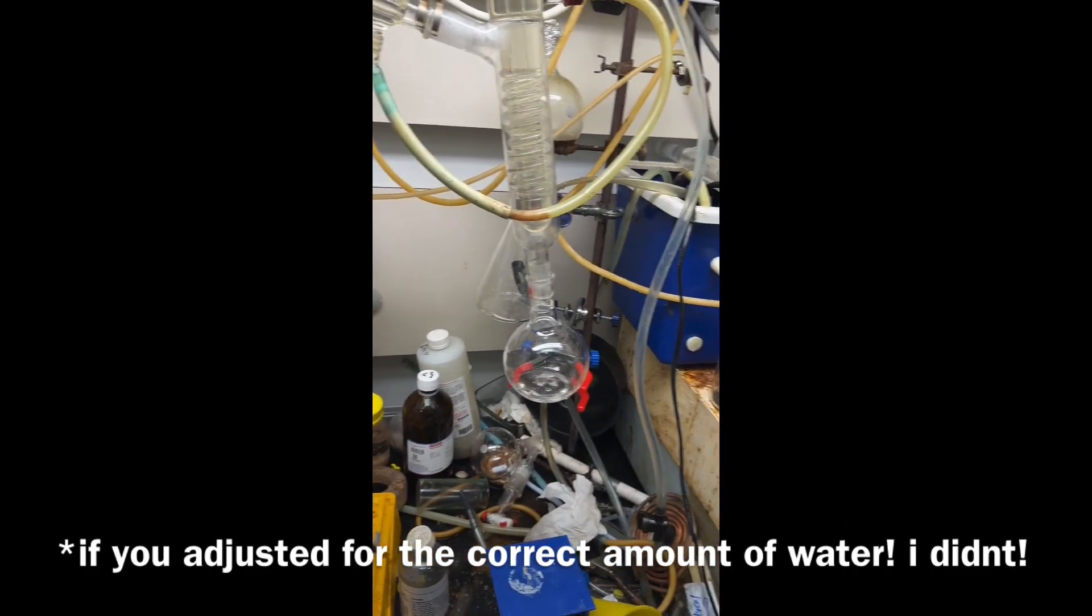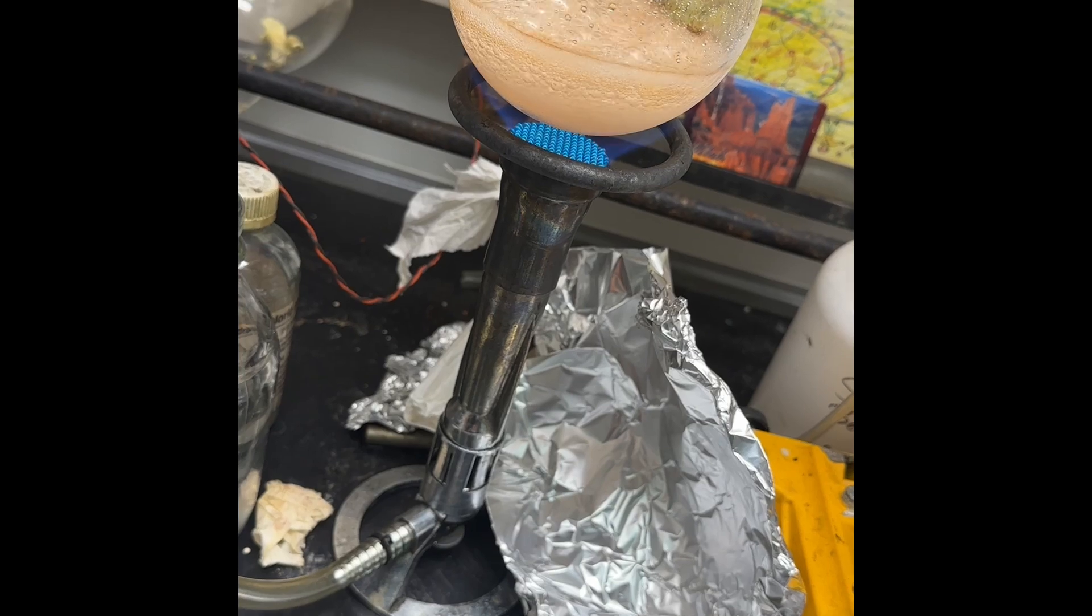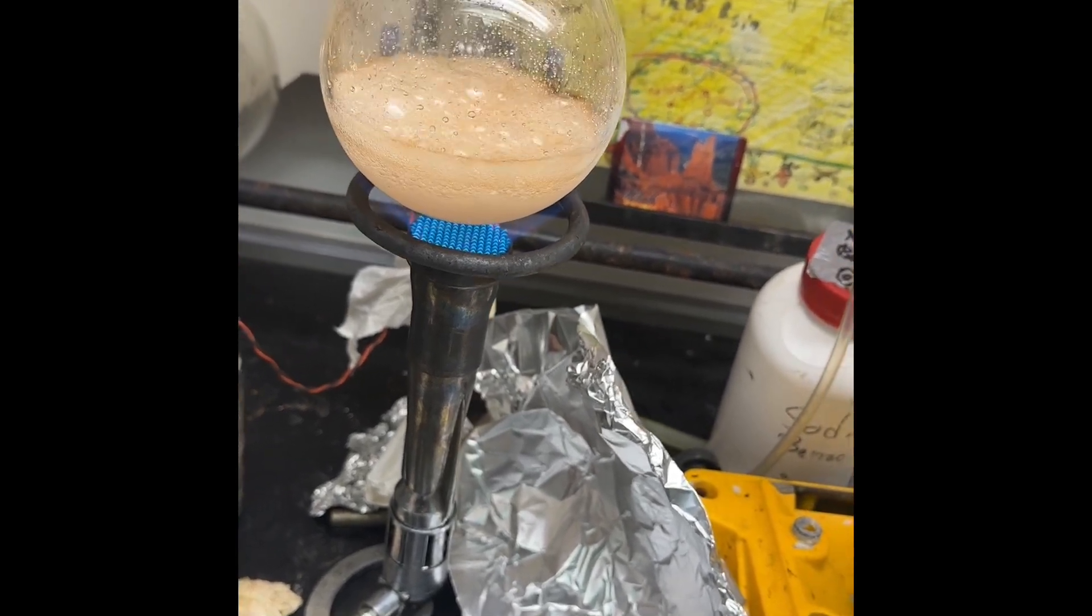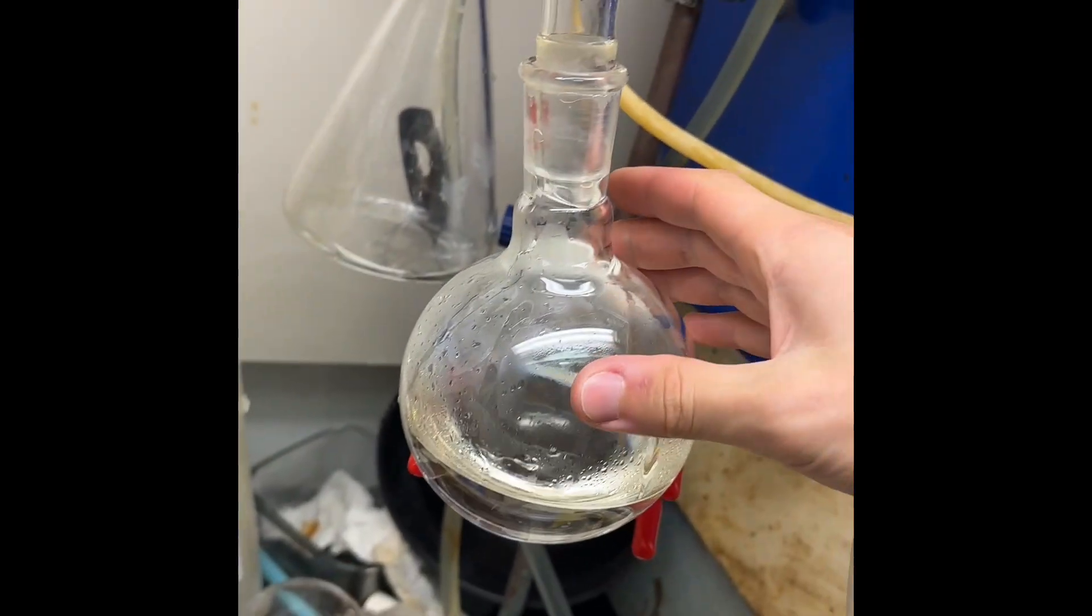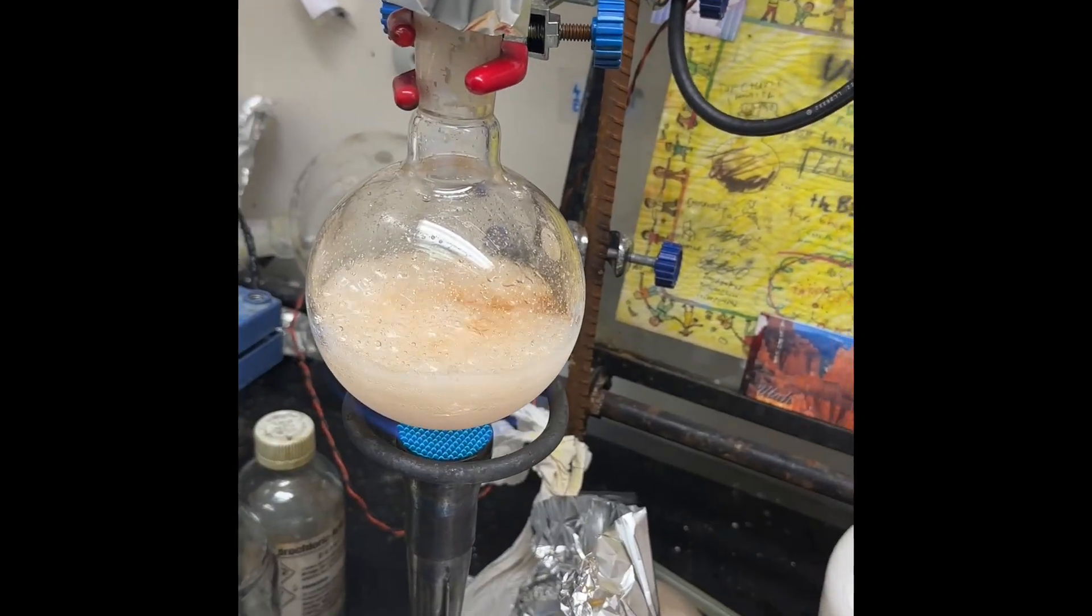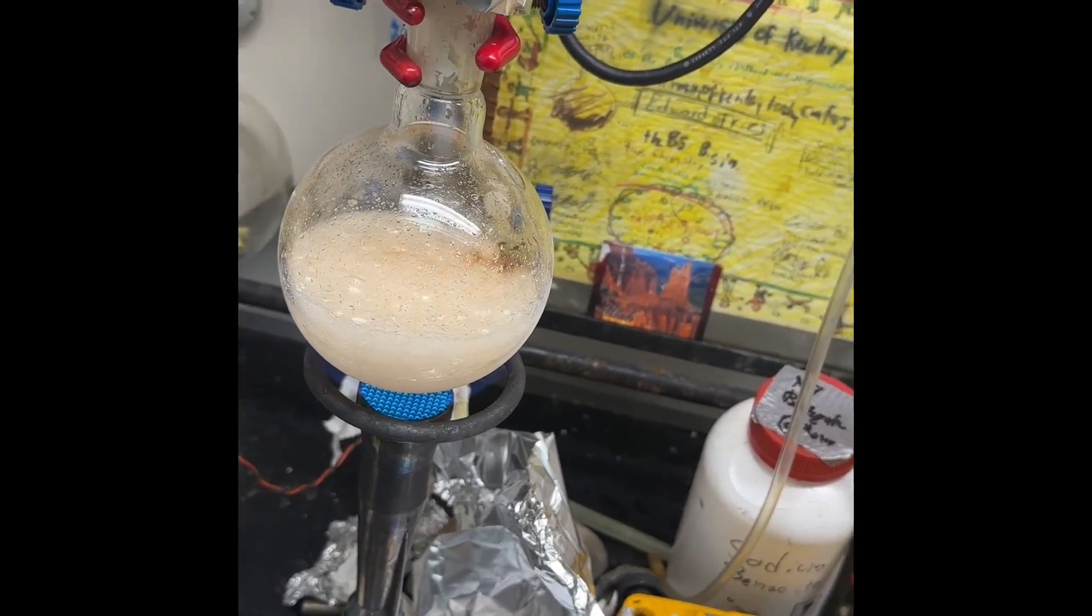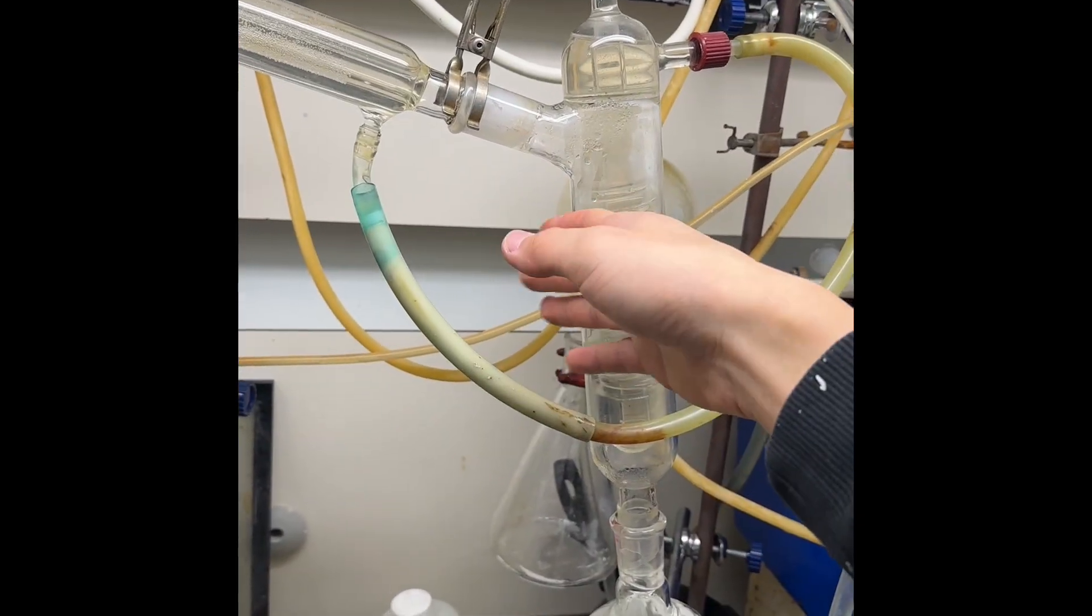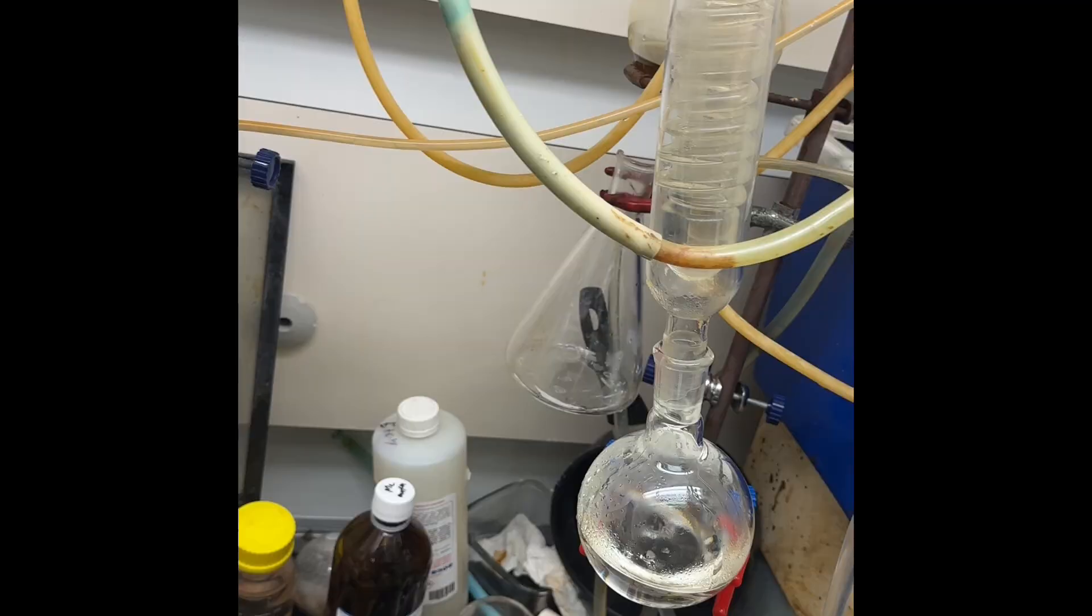We're getting this viscous mixture. I heated it a bit more to try and get everything over, so my acid is going to be slightly more dilute, but oh well. Whatever coloration is in there is completely not bromine, it was probably something like iron. This condenser should be rearranged out of the way because it does not cool vapor very well, so the acid coming over is a bit warm and it causes it to do that sometimes.